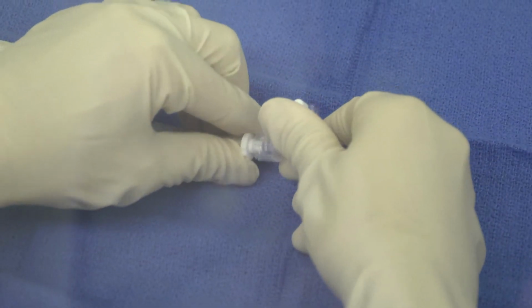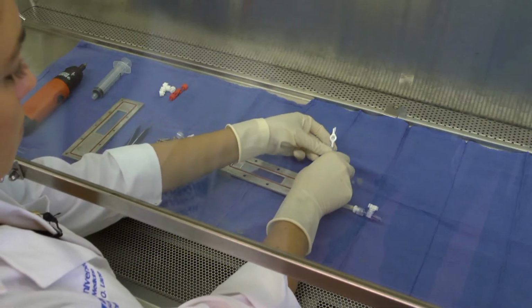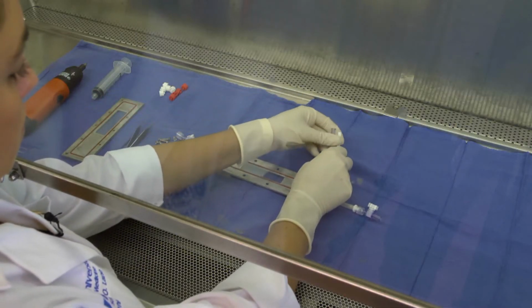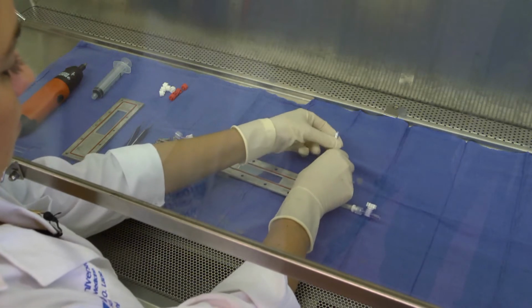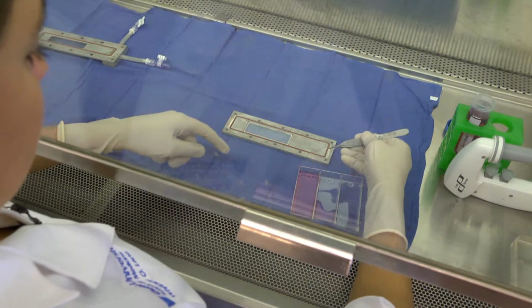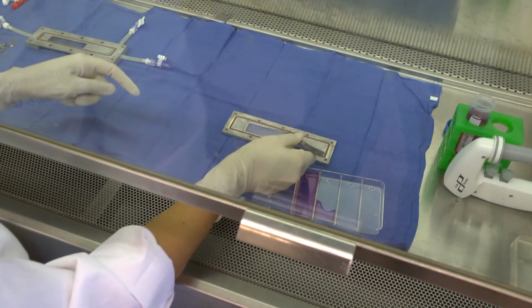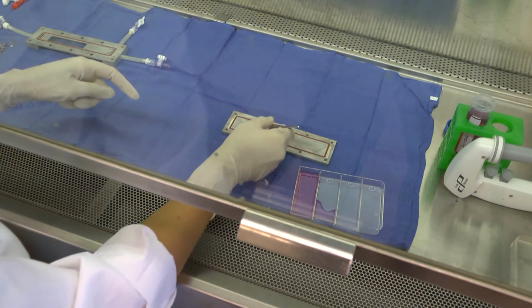Attach 4-way stopcocks to both of these luer adapters. Connect the remaining 2-inch soft tubing piece to the side port connector coming off the bubble trap and attach a 1-way stopcock. Using sterile tweezers, remove the cell-seeded slide from the cell culture vessel and place it into the recess on the bottom plate of the flow chamber.